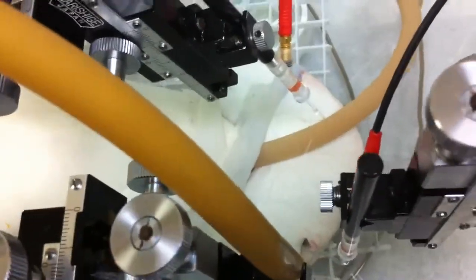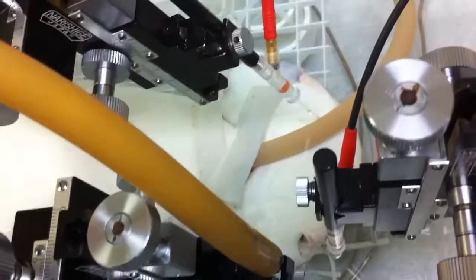This electrode is the reference electrode, so it's just in contact with the skin, to provide kind of like a background signal that I can subtract out.